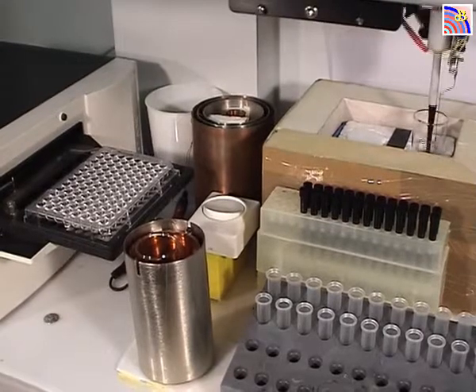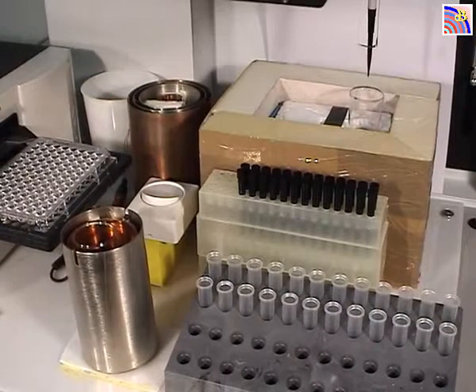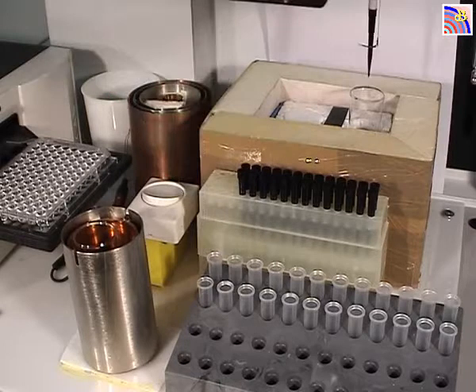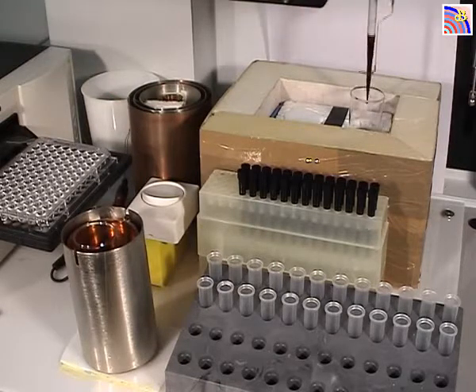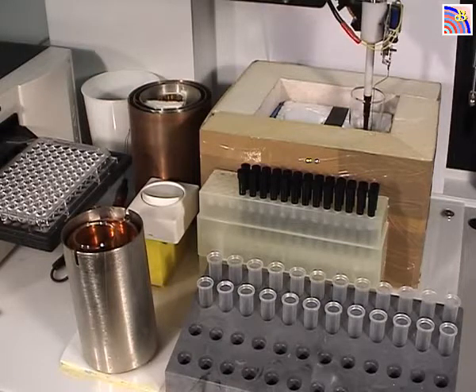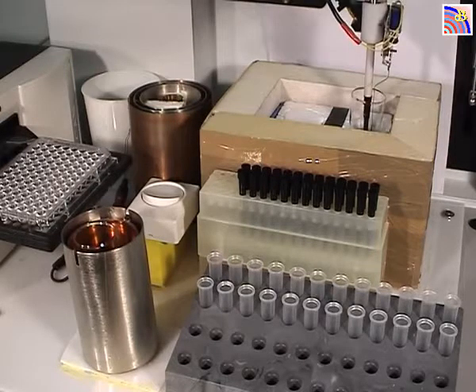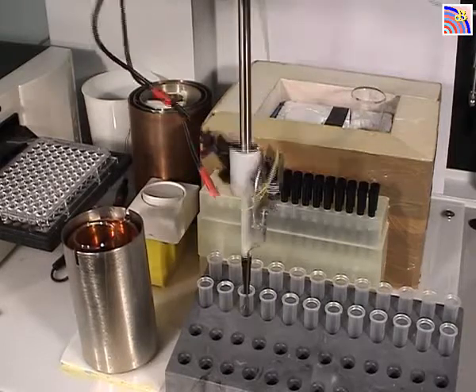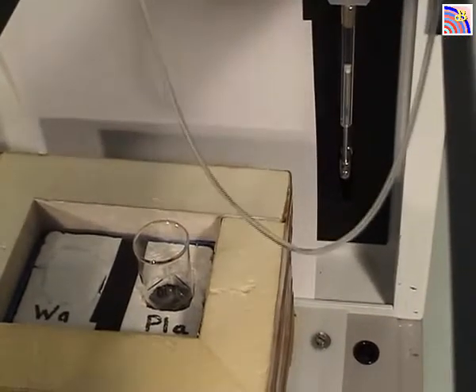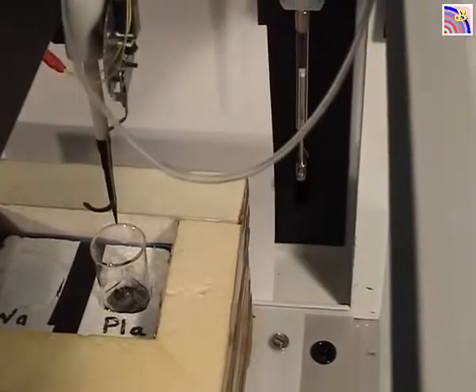Now it's collecting the plasma and will put it in front. Each sample is always 200 microliters, so that will be 200 plus 200 — 400 microliters. Then it will do the same for the second tube and the third tube. That's the plasma. You can see the syringe moving up and down, aspirating and ejecting the contents.